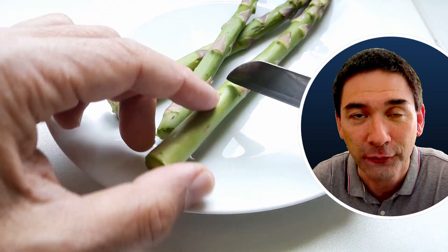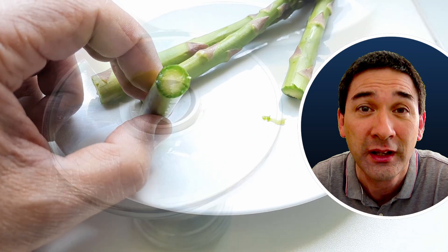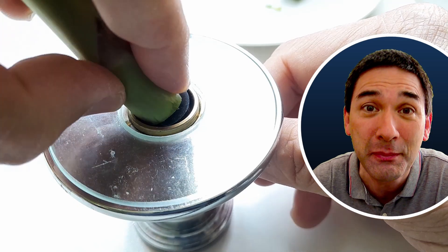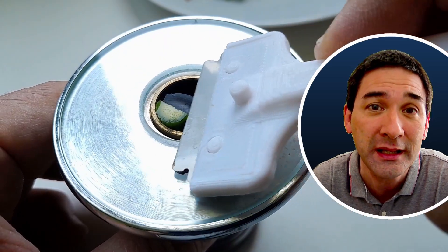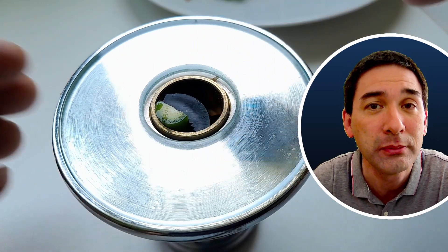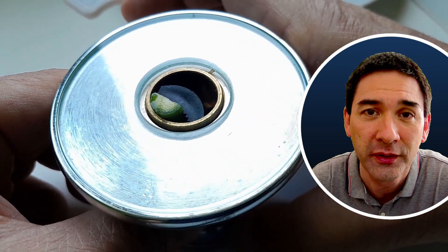That's actually one difference, but other differences can be seen under the microscope. I'm going to show you how you can prepare an asparagus. It was way too big so I had to make it smaller, and then using a sharp razor blade and my microtome I was able to cut very thin sections of the stem of the asparagus.